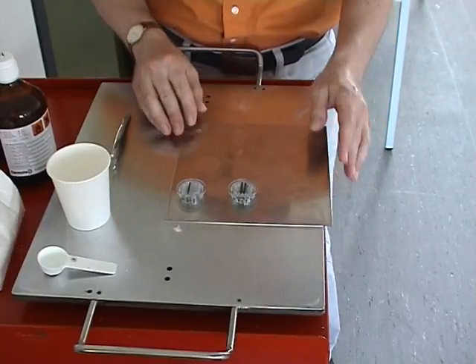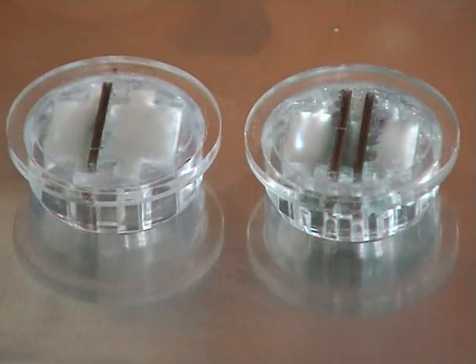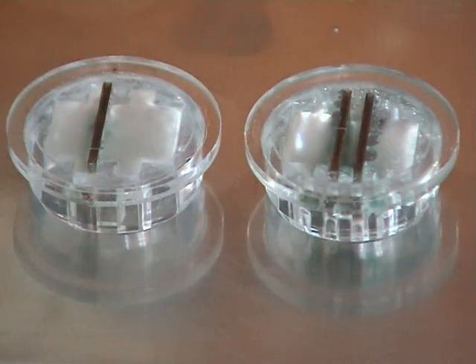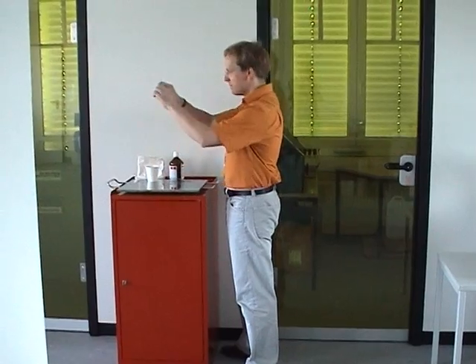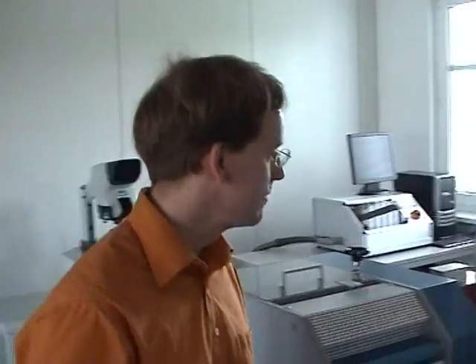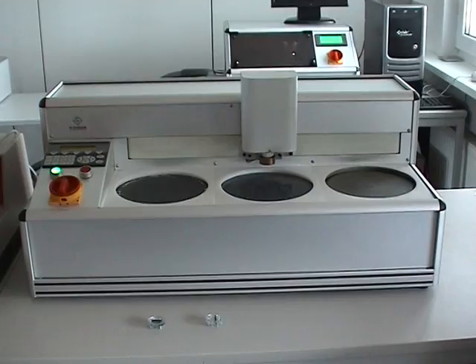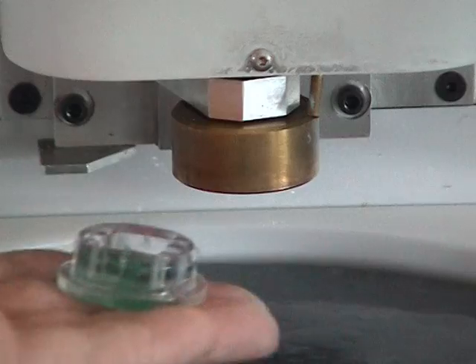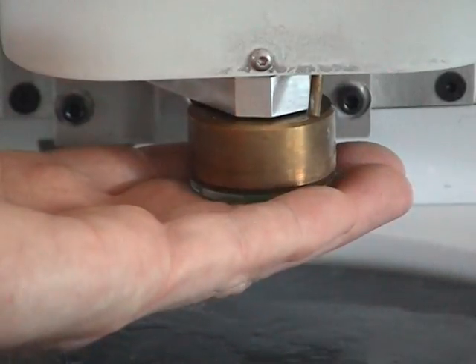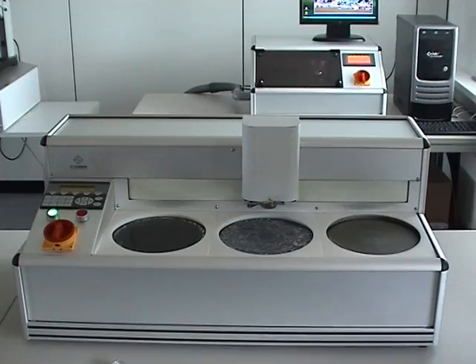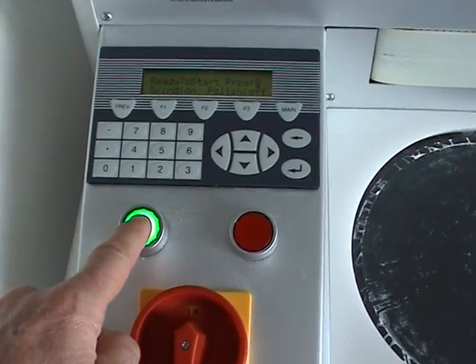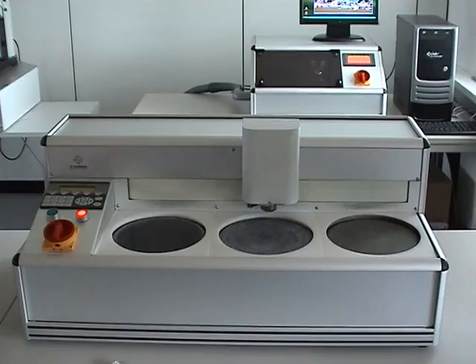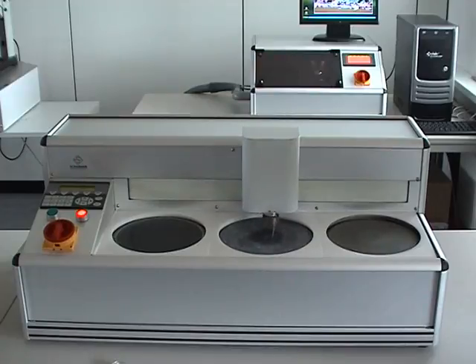After 30 minutes for curing, the specimen can be used directly for grinding. For grinding and polishing, we will now use our grinding and polishing machine as well. The embedded specimen fits exactly into the holder of the SPA machine. The SPA machine can be controlled and programmed through a foiled keypad.